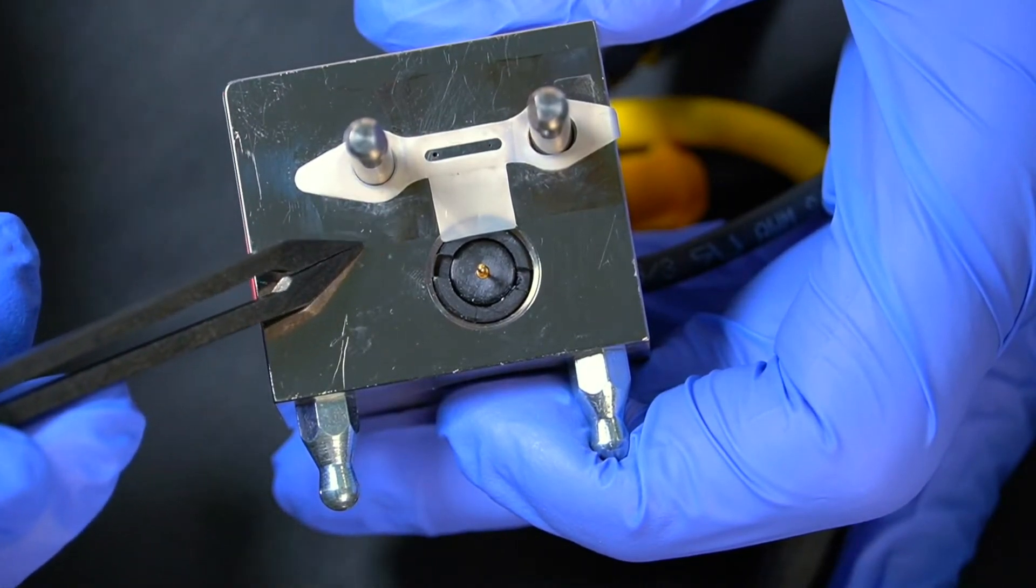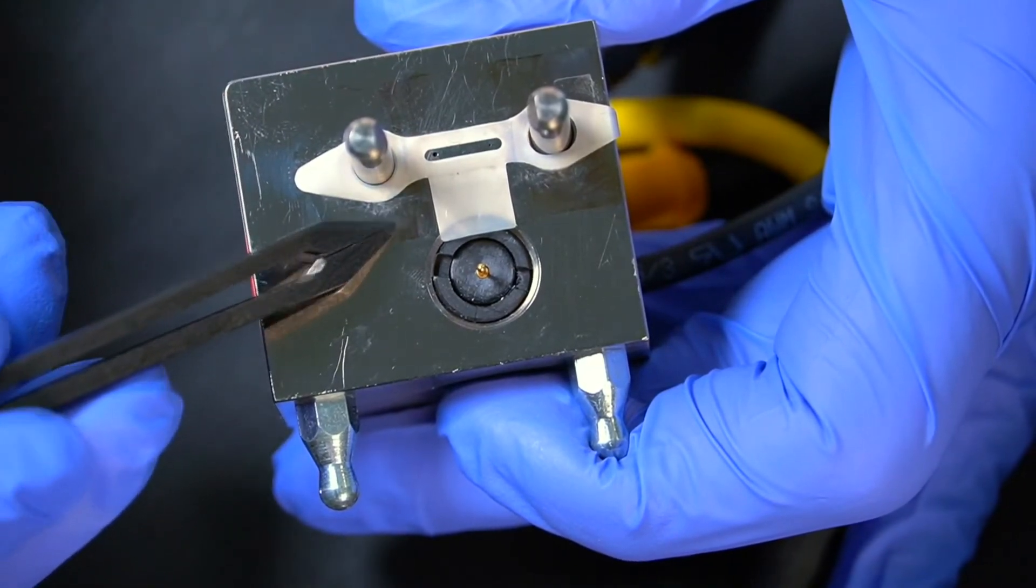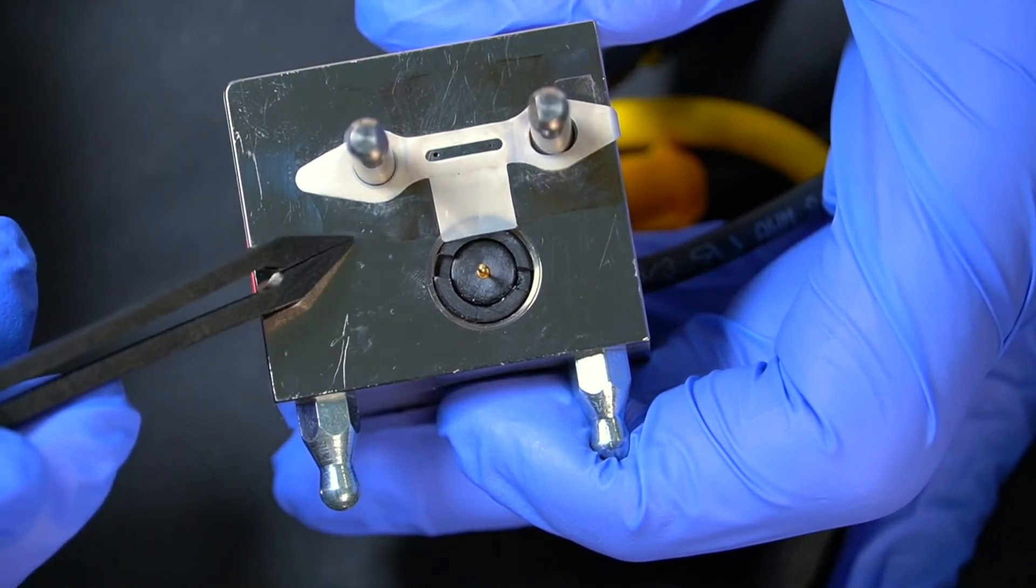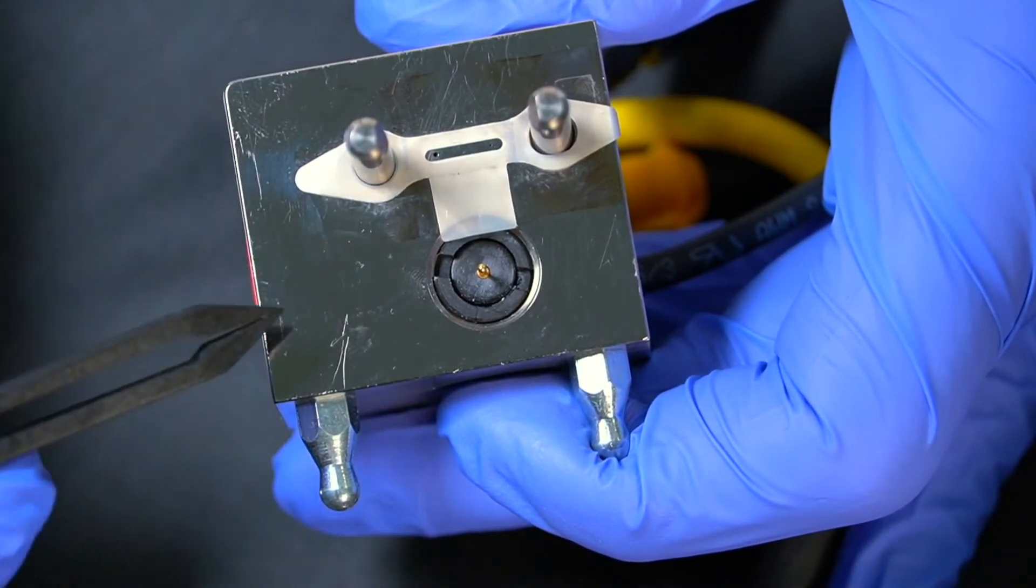That's nothing to worry about. Once you've used the cell for a while, it won't look quite as shiny and new as it was when you first got it, but that won't affect your results at all.